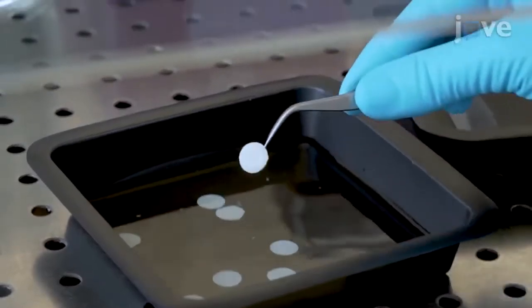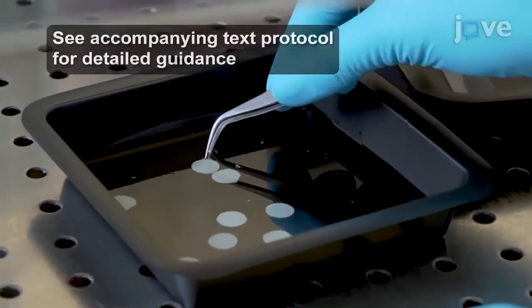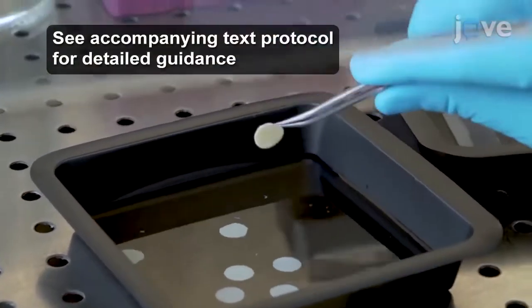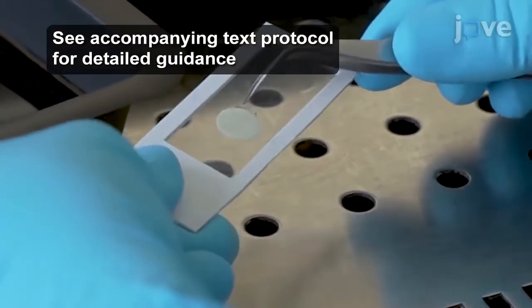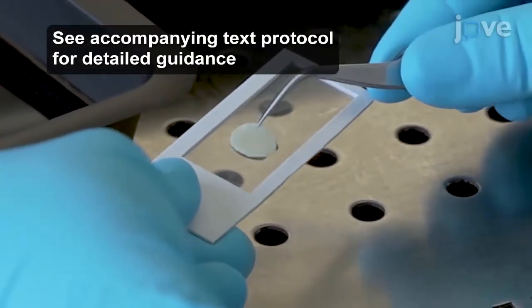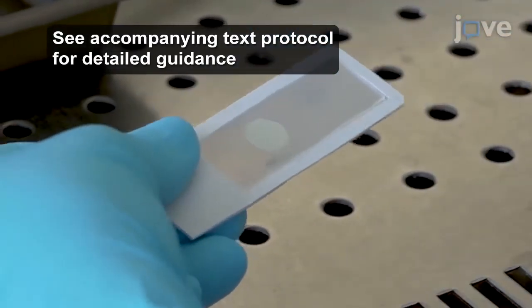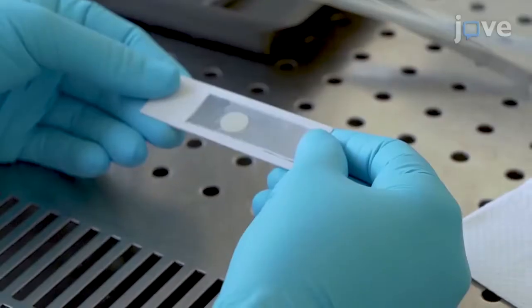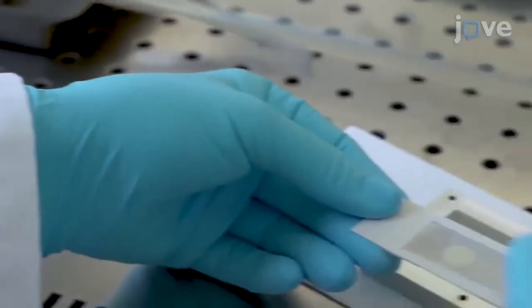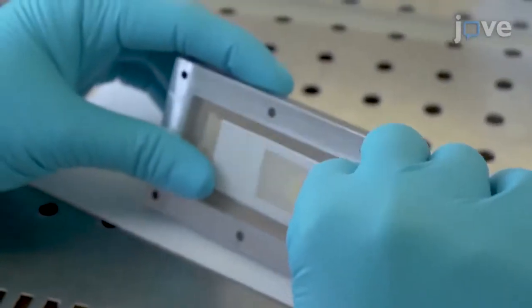To begin the protocol, place a previously prepared tissue biopsy 10 mm in diameter and the same thickness between a microscope slide and an 8 mm circular perforation in a rubber gasket, with the inner surface facing up to contact the bacterial suspension. Focus on the tissue graft orientation while placed in the holder. Make sure that the inner surface of the tissue, physiologically exposed to the bloodstream, faces up to contact your experimental medium.